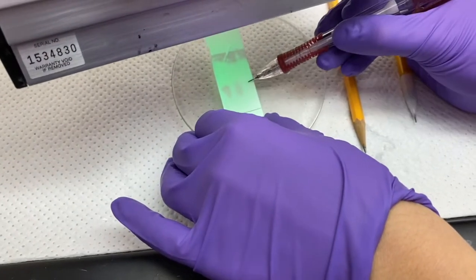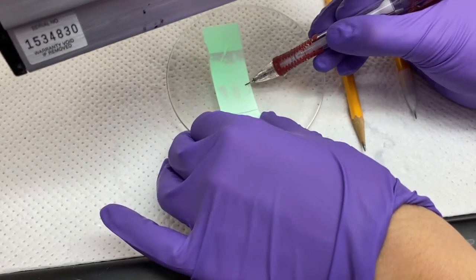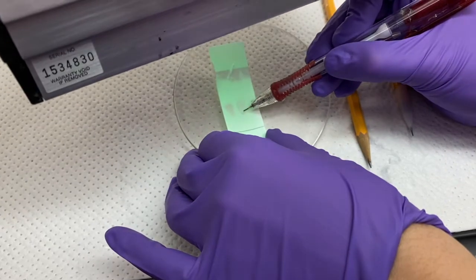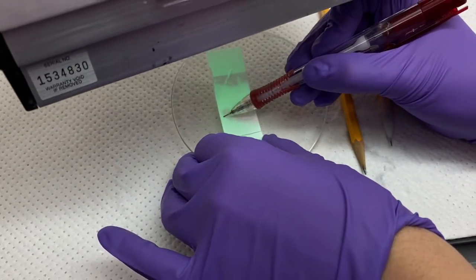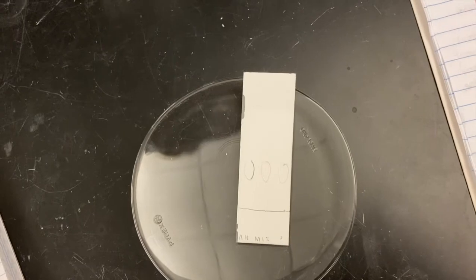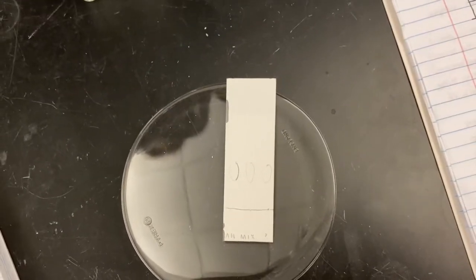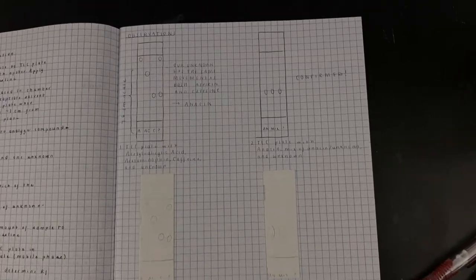The expected result was that all of these migration patterns would be the same. If they are the same, then you know that you have the same compound in all three of your lanes. In our case, they were, so we were able to confidently conclude that our unknown sample was in fact Anacin.